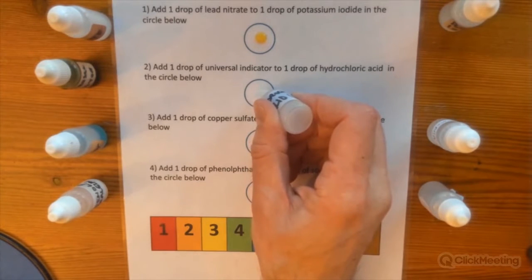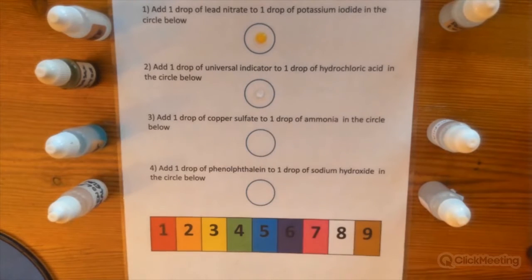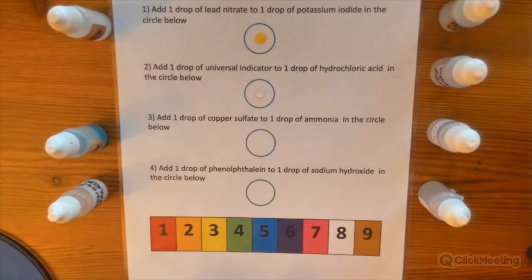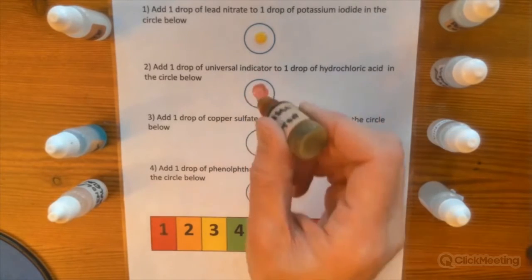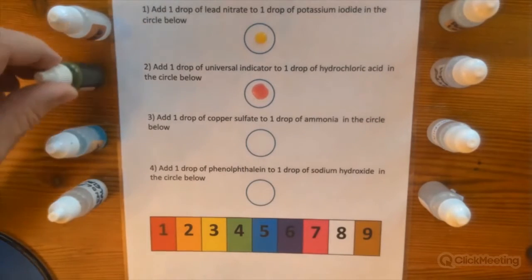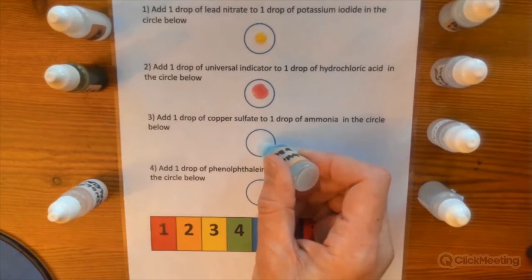The next experiment involves fairly dilute acid, hydrochloric acid. It's at an irritant concentration, about 0.1 molar rather than a corrosive concentration. And to this, I'm adding some universal indicator, which will give a red color overall. So this introduces pH. For younger people as well, the names of the chemicals can be quite intimidating to them. So it's a literacy exercise for them that they can follow instructions and add the correct chemicals and get the correct result, especially when they're first coming to a science classroom.